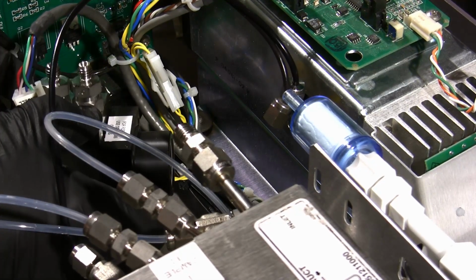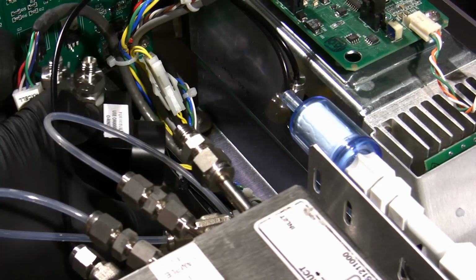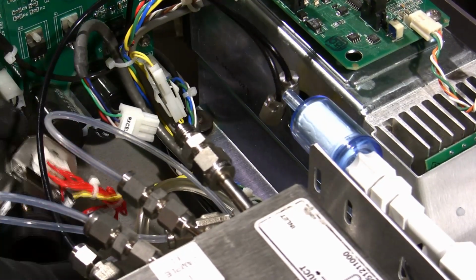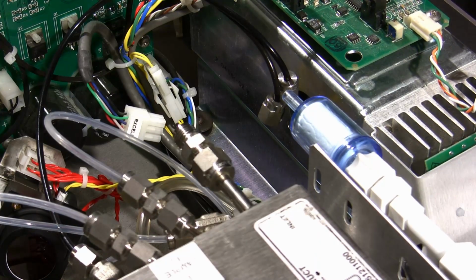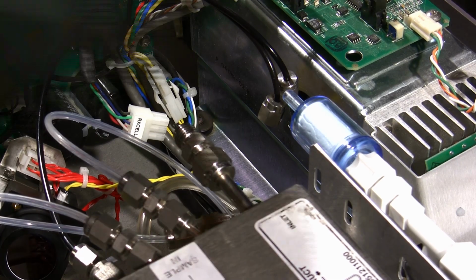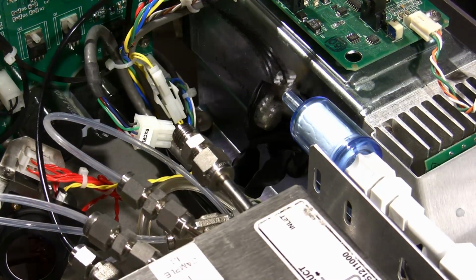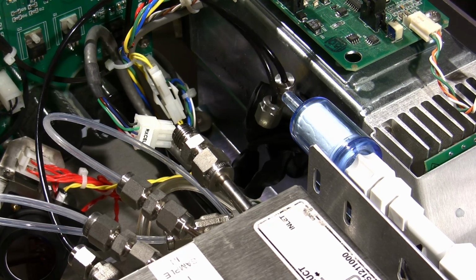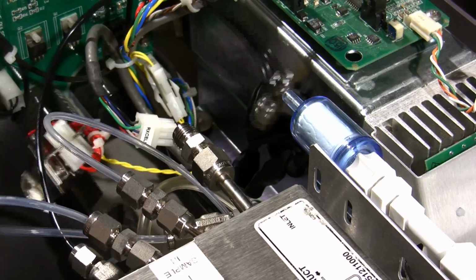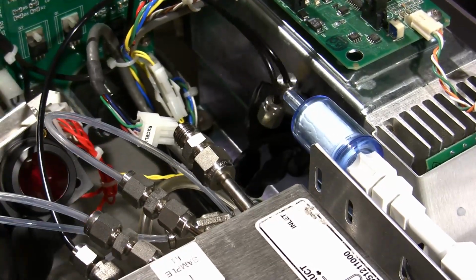Try to get that out of there. You'll see a lot of heatsink paste on there. So once we've got that out, typically what we're going to want to do is cover up with something dark just to keep our ambient light out of the photomultiplier tube. If we can keep the light out of that tube, our response is going to be a lot better once we get this all put back together. We won't have to wait for that PMT to settle down as much. Just keeping track of O-rings and parts in here.